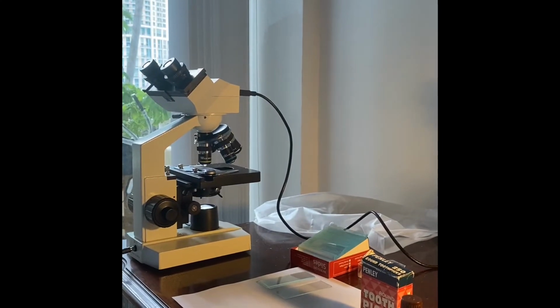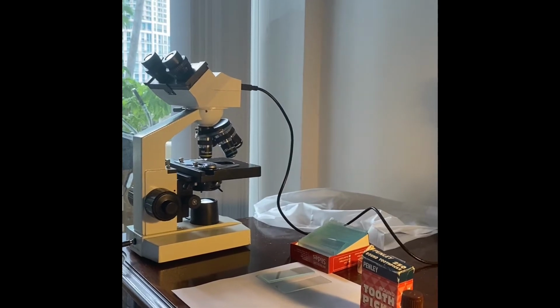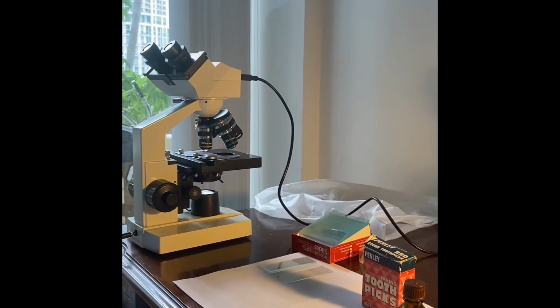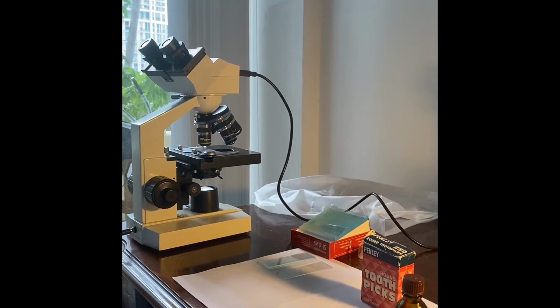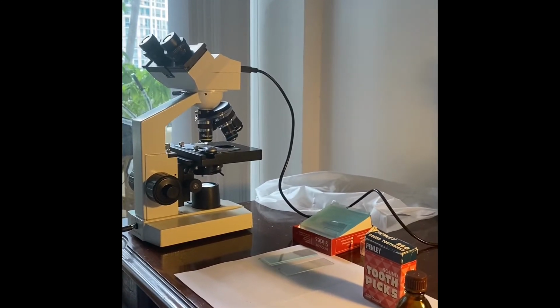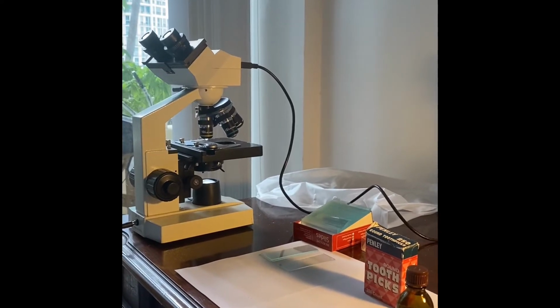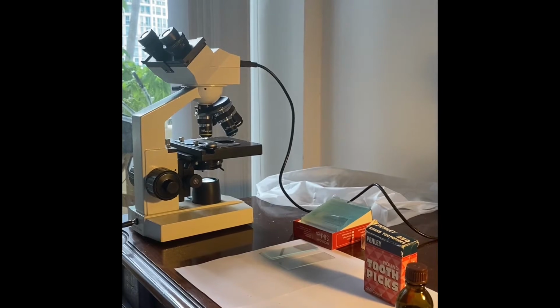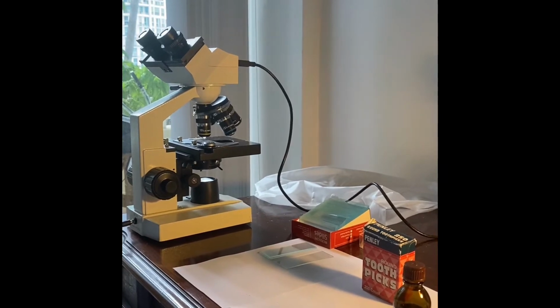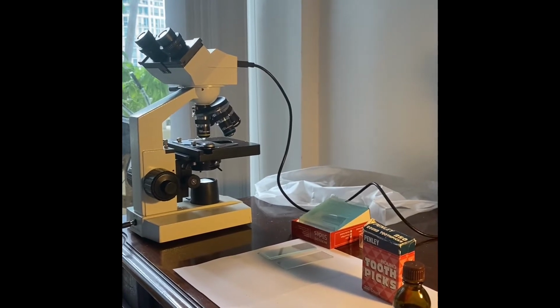It is wonderful to have you all back again. Keep up the good work. Let your passion for learning be the driving force for every experiment to follow. The next cell you will be viewing is found in each and every one of us. In this case, you are the human specimen. Isn't that special?